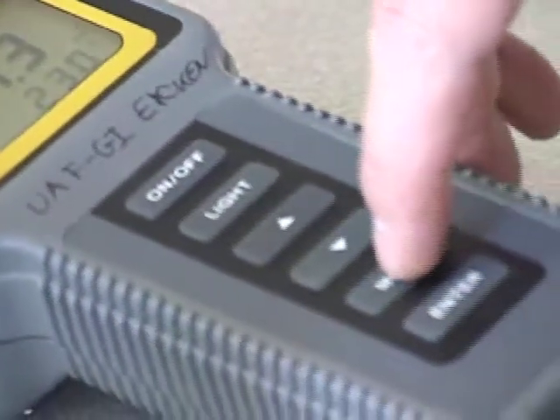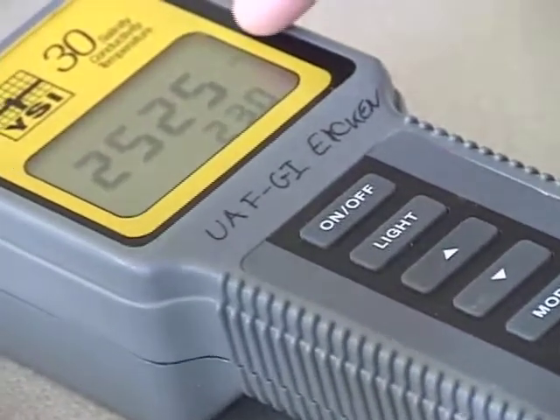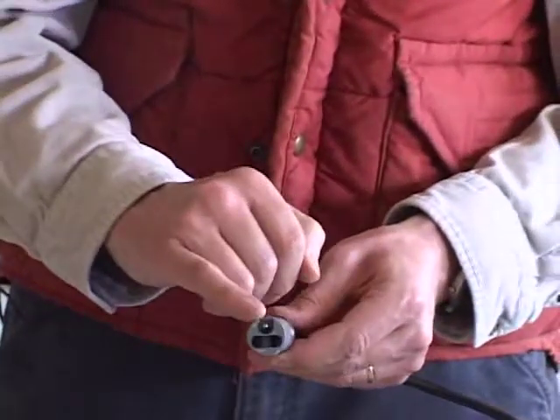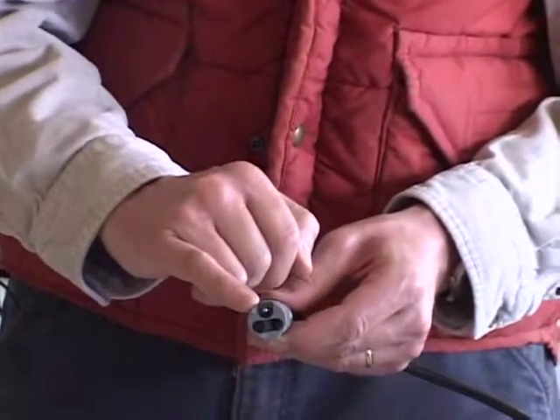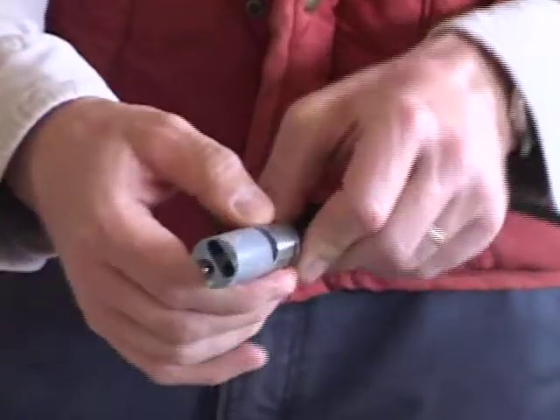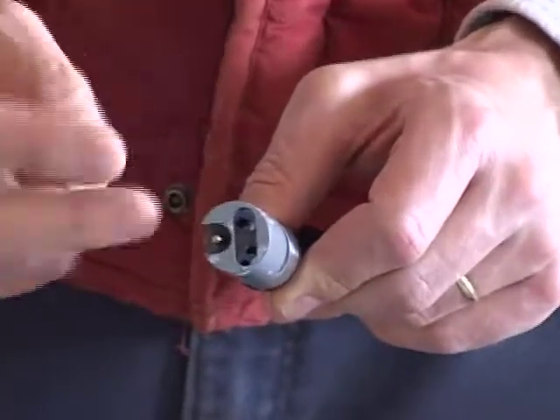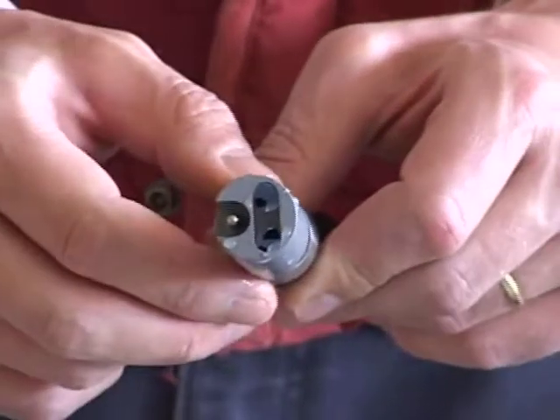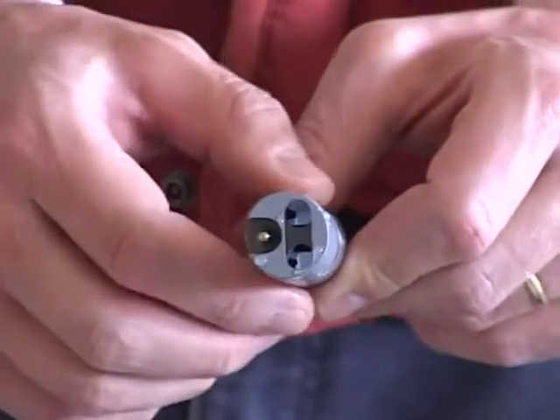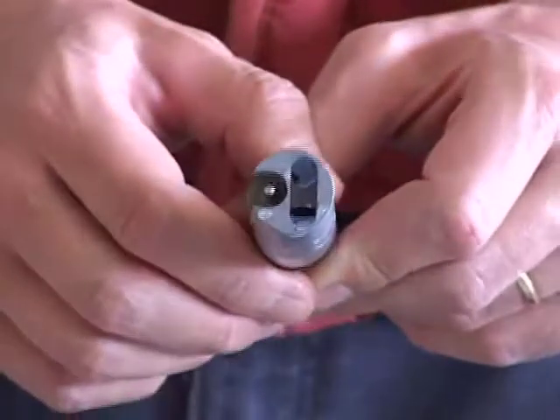You have the actual display here and the actual instrument, and then we have a separate probe that has a little thermometer here at the tip to measure the temperature of the water. And you can see there's a little opening here, and that opening leads to a small volume where we have two electrodes pointing into the volume of water that we're sampling that determine the electrolytical conductivity.